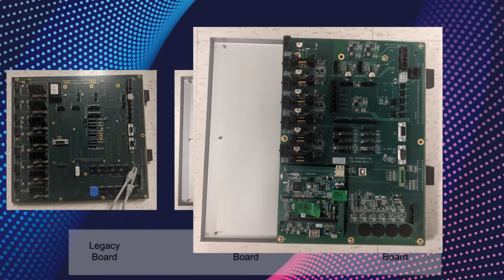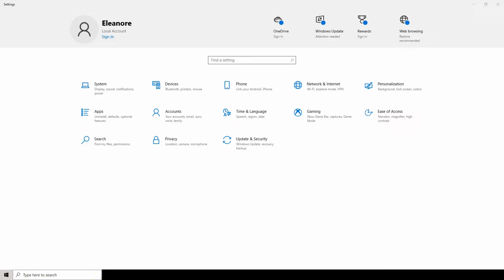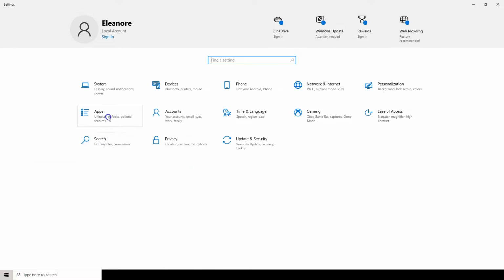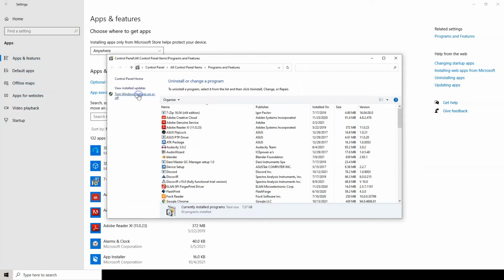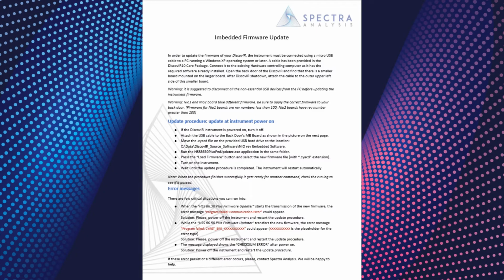Computers configured at the Spectra factory will have the programs installed for this update. However, to perform the NIO's MB board update on a new computer, the user must enable a Windows .NET function on the computer and add the required software from the USB stick included with the DiscovIR10 care package. To enable the Windows .NET function, go to Settings, Apps, Programs and Features, turn Windows features on or off. Click to enable the .NET Framework 3.5. Once this is turned on, follow the document called Firmware Update Guide.